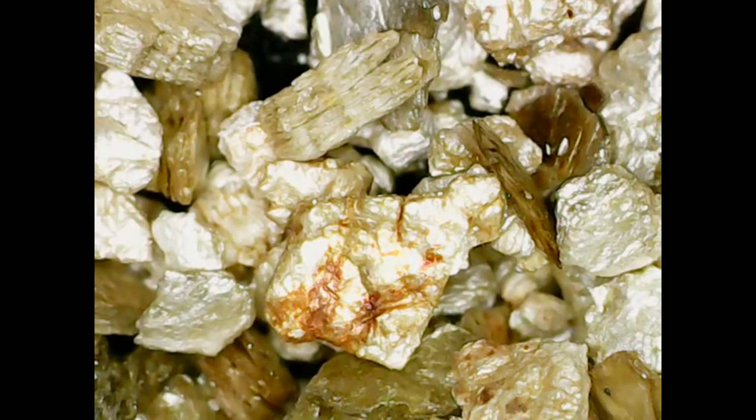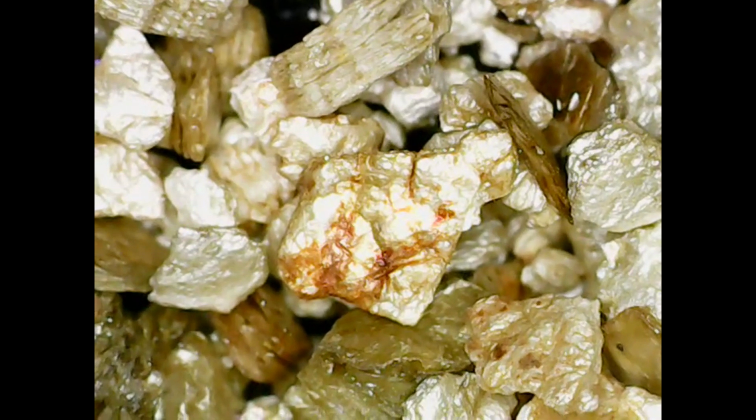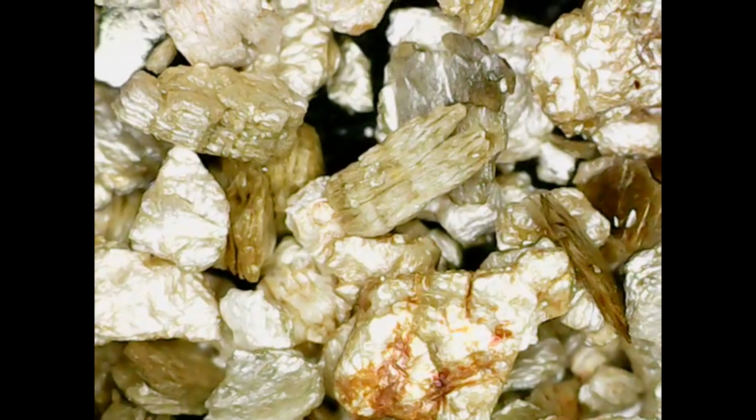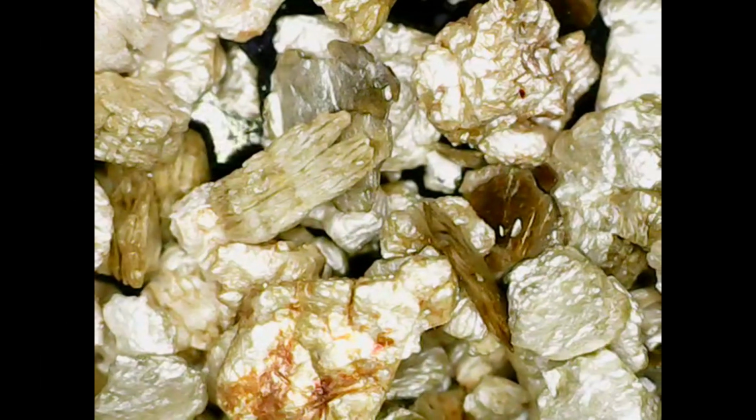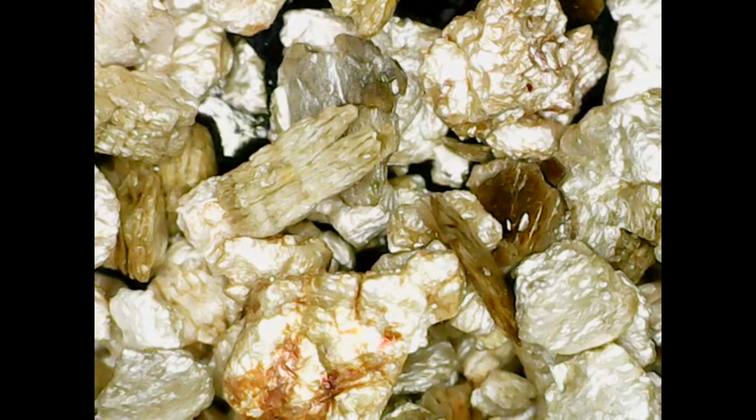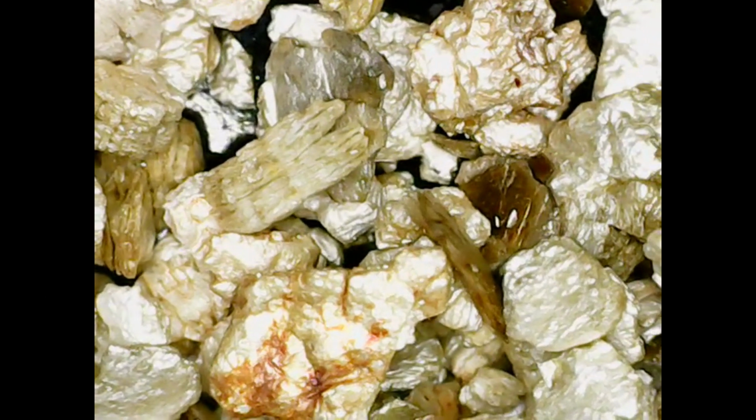under the microscope. So if you're looking at it here, you can clearly see that essentially it almost is reminiscent of rocks that you might get, and you get some of those striations. You can see that one section there, one piece of it there, and it's quite interesting because this has also got the grooves, but it's got it in a more linear format. The way that it obviously expands is much more linear rather than it has some divots.